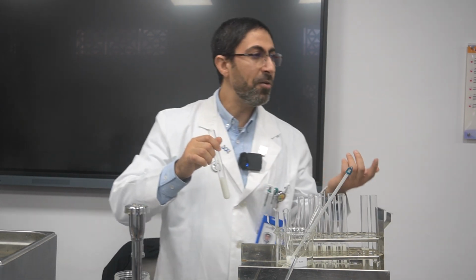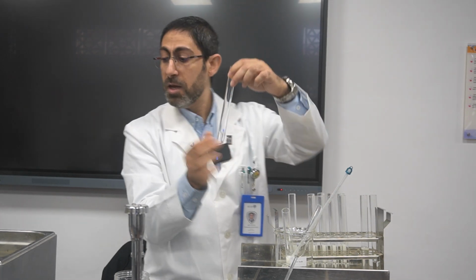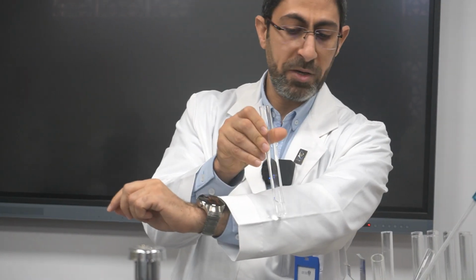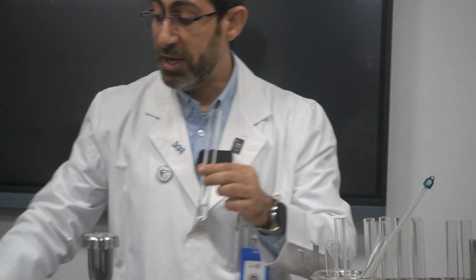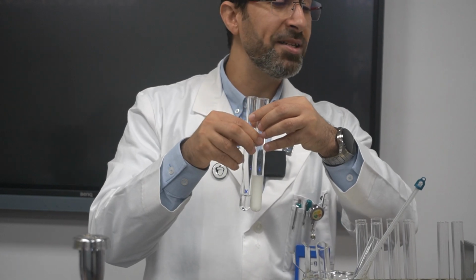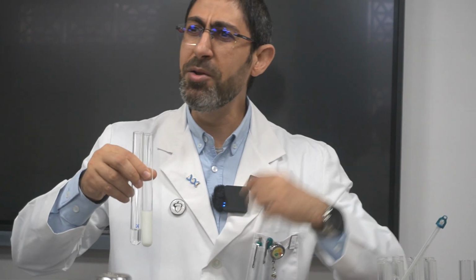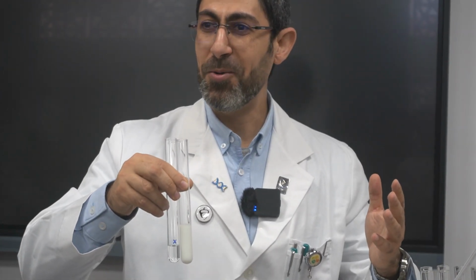My question: how can I identify that? Here I have the X on a white cardboard, or even on your lab coat. If you can clearly see the X that we labeled on the test tube, it means that the protein casein is being broken down by the enzyme trypsin, and the solution is clear. Actually, I will use the word clearer, because it will not be very clear. Okay, what is the reason?